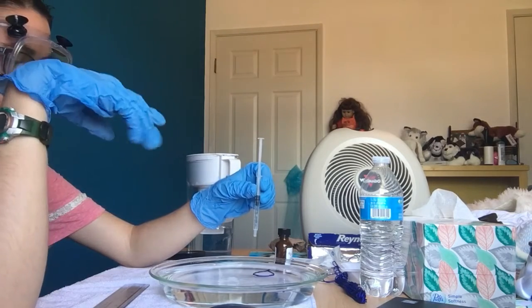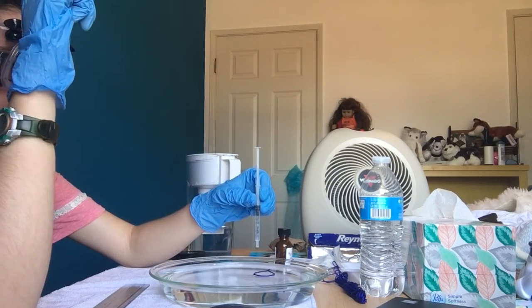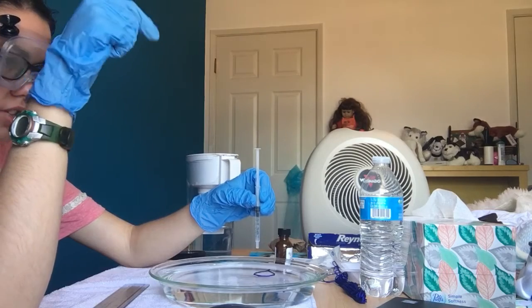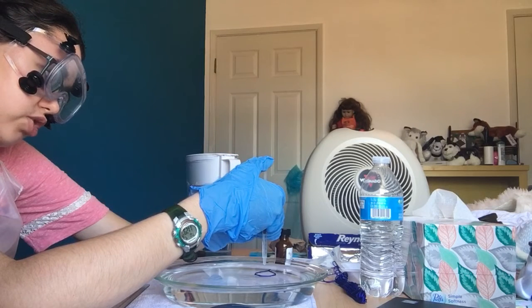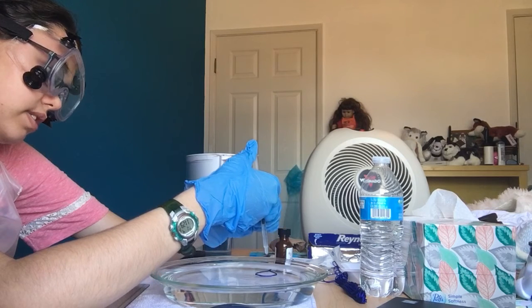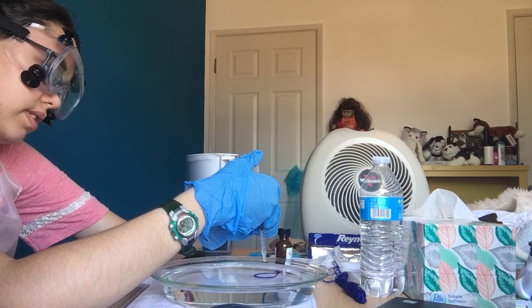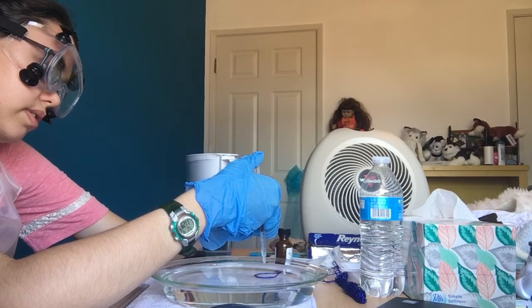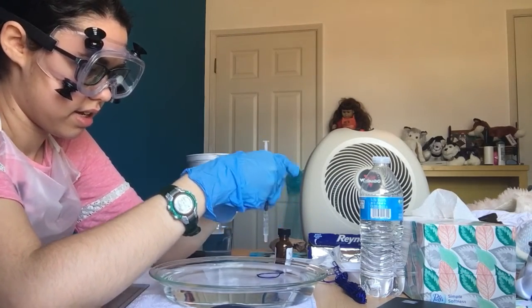So when it forms a circle, how circular is it supposed to look? Can it be slightly teardrop shaped, or does it have to be an exact circle? It has to be a full circle. Okay, so it's still teardropped. Might have been how I tied it. If it's where it's tied, there's like a point. That's okay. It's mostly okay. Circle-like. Okay.